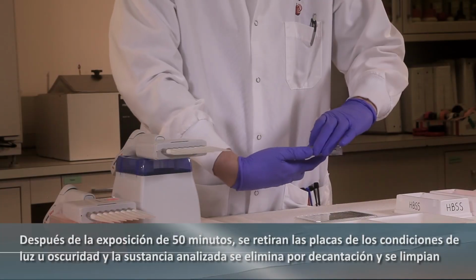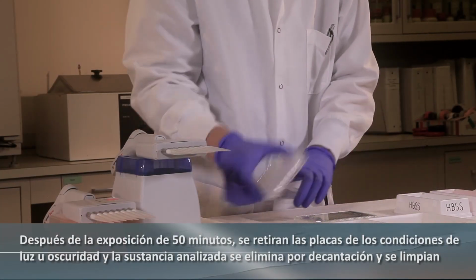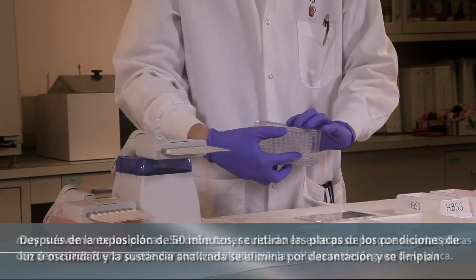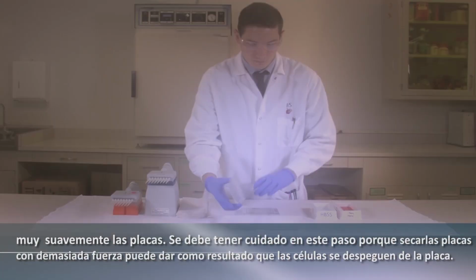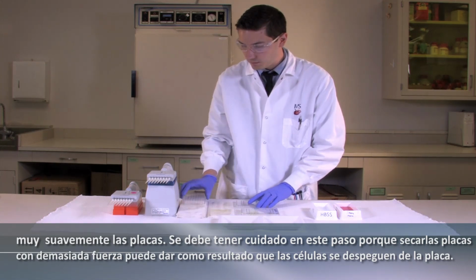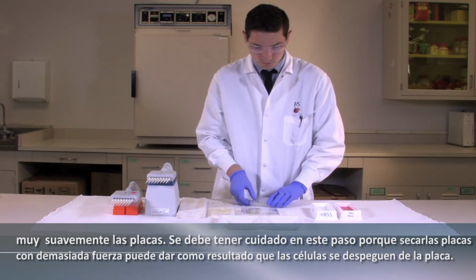After the 50-minute exposure, plates are removed from the light or dark conditions, and the test substance is removed by decanting and very gently blotting the plates. Care must be taken at this step since blotting the plates too vigorously may result in cells dislodging from the 96 well plate.